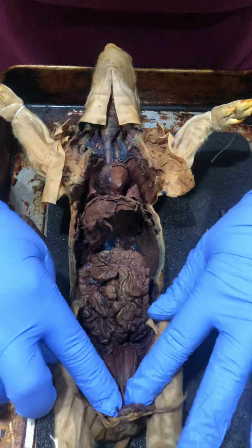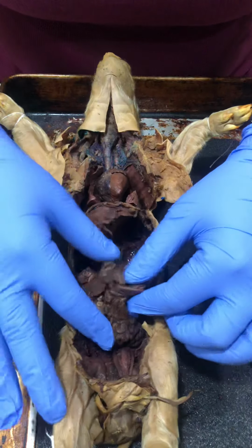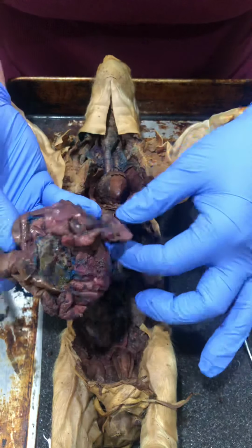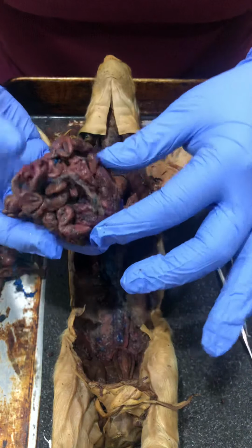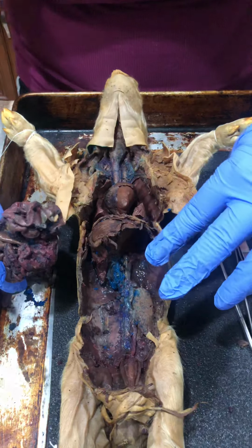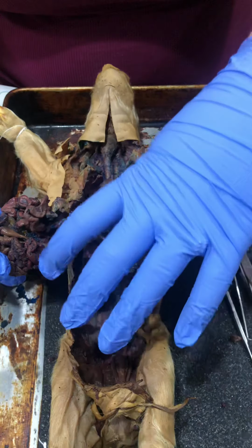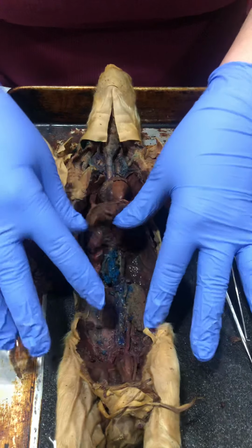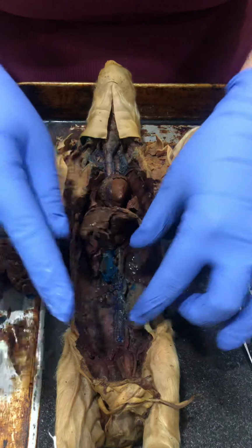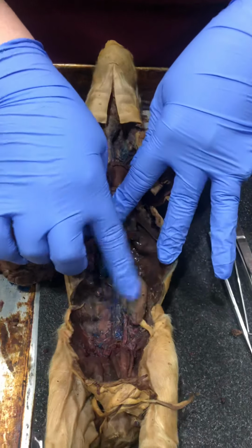I went and pushed this down, but right here are the small intestines, as you can tell. All this stuff right here, and if you go all the way to the back, the small intestine goes into the large intestine right here, okay? So I'm gonna take that out, and it was kind of connected down to a tissue covering the kidneys, and that was the peritoneum tissue, so that covered it. In order for me to get to the kidney area, I had to cut that portion out, but that's what surrounds it.